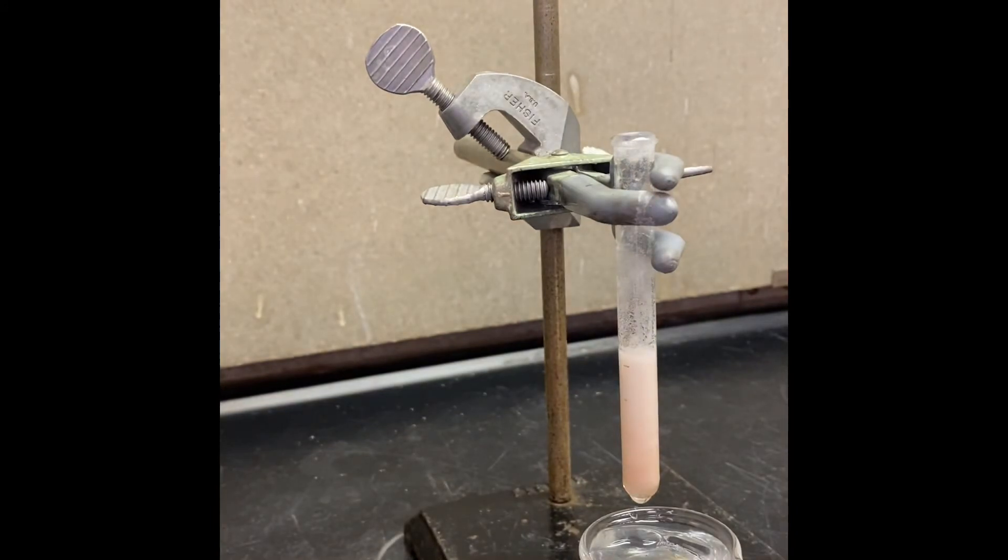That's how that looks like right now. Now we're going to filter that out with the vacuum filtration, and then we're going to wash that with the water.